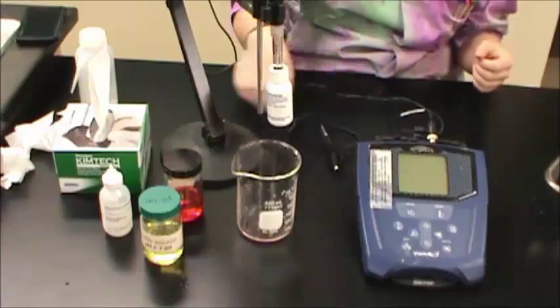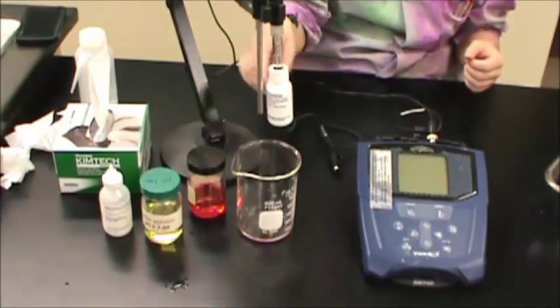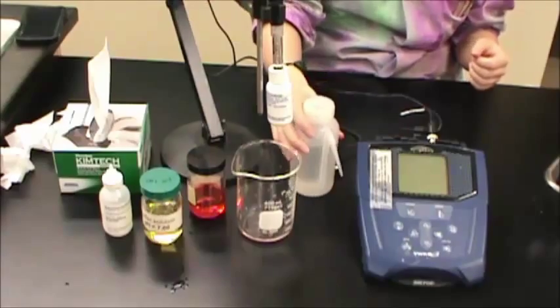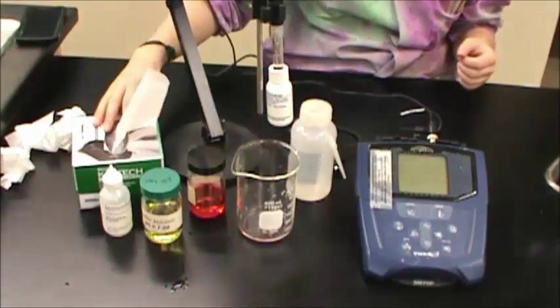Two separate pH buffer solutions, deionized water and a waste beaker, and some Kim wipes.